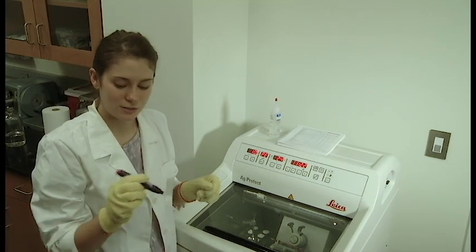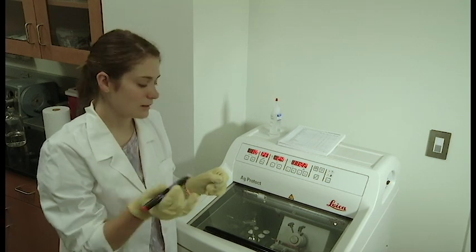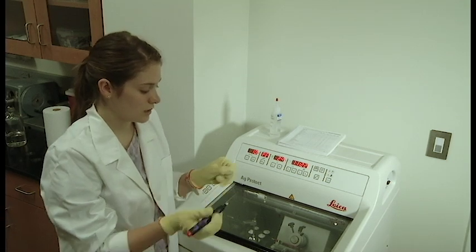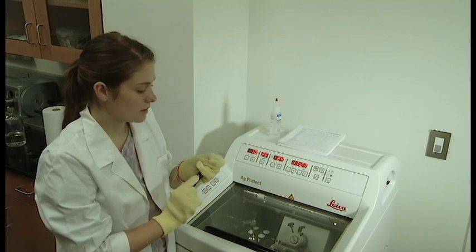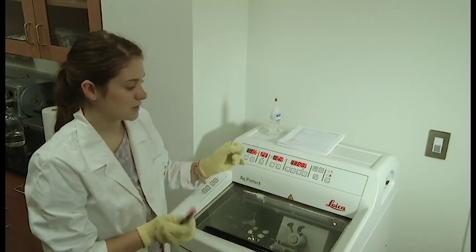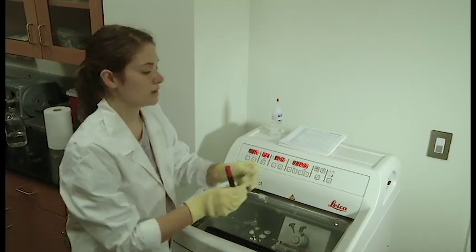But to increase that, you can also use this kind of glue pen and you just draw on it just as you would a marker and then go ahead and pick up your slide the same way, which we'll show you in a little bit.